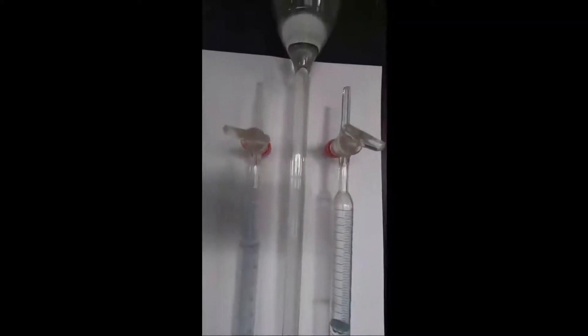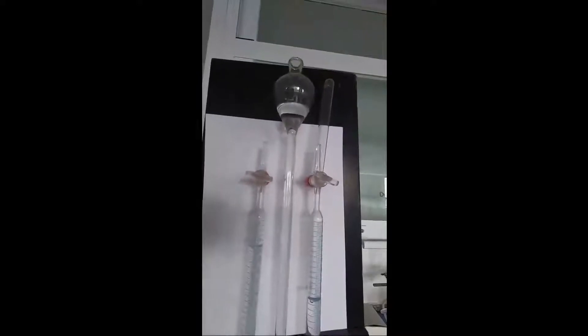What we're going to do now is see if we can identify these gases. We need to actually collect the gas. All we do for that is put a test tube over the top of the one that's got the most gas in, and then we're going to open the tap and see if we can identify it.